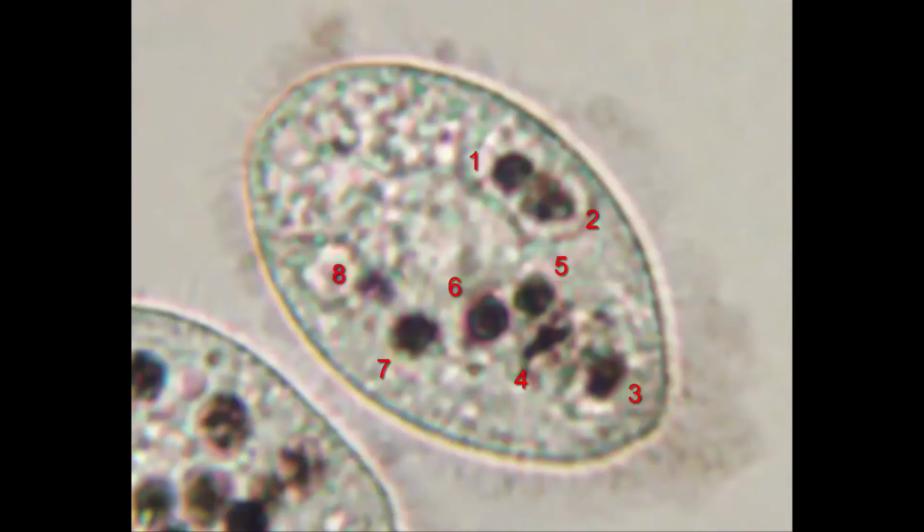If you use different standards for what counts as a vacuole for your control and your experiment, you're introducing a bias that can skew your results. And unless you're actively thinking about this and avoiding it, you could be doing it subconsciously.